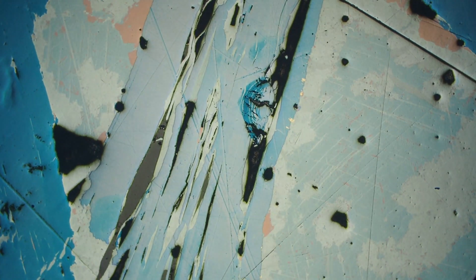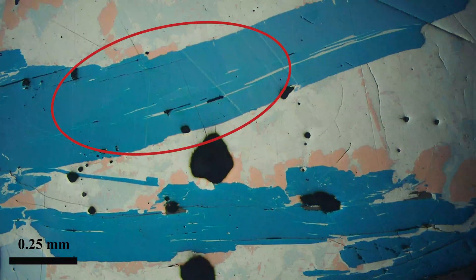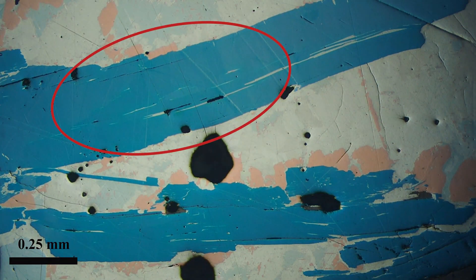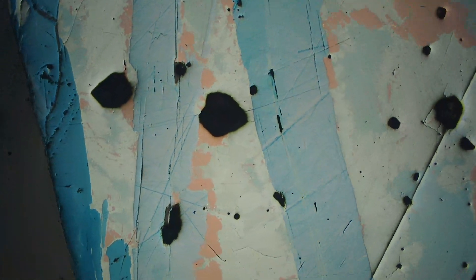In summary, how we identify covellite in polished section: it's strongly bireflective with strong blue to violet going to bluish-white as we rotate the stage. It has strong anisotropy going from red-orange to brownish in color as we rotate the stage. Other characteristics are that it often has long radiating crystals with perfect cleavage, and it's quite soft so it tends to be recessive in polished section.